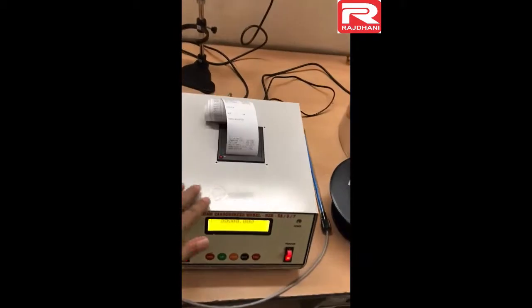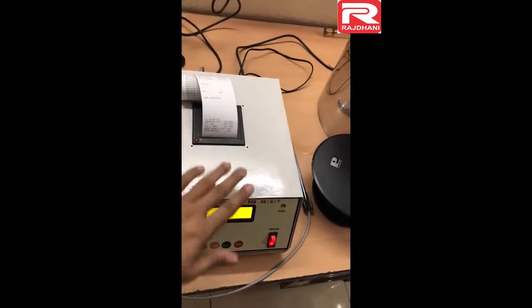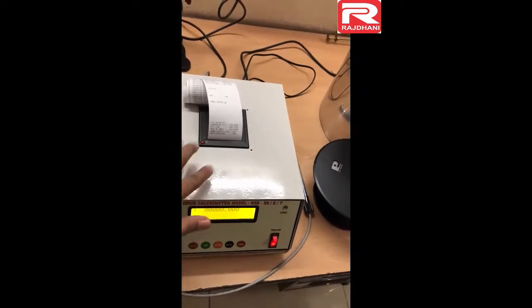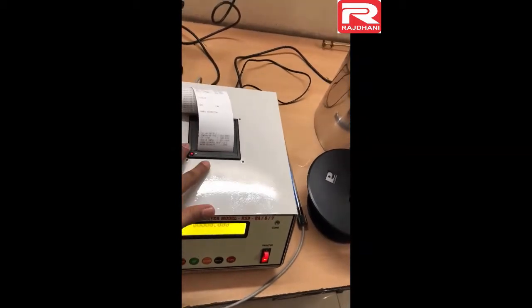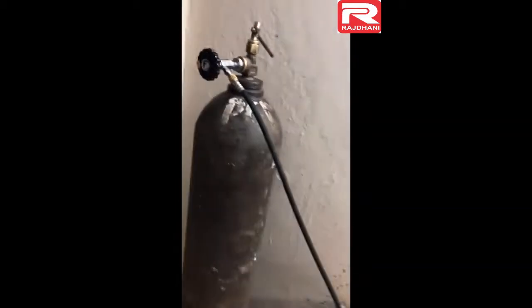In case of model RSB 6, we do not have the auto gas unit. Instead we have a manual oxygen filling arrangement with an oxygen control valve and a flexible tube.